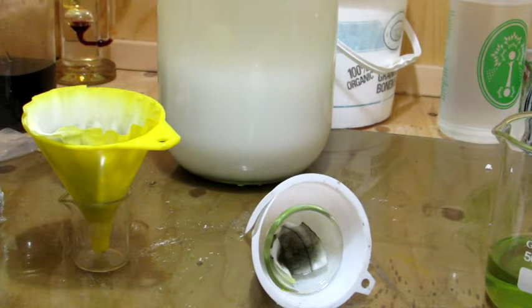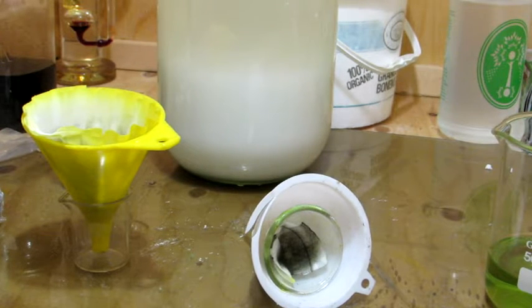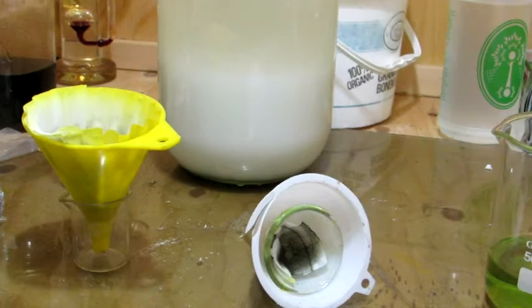So you can see here that the solution that passed through the filter is green, and I did have to add a bit of water to it to help everything get through and to make sure that we wash our boron.